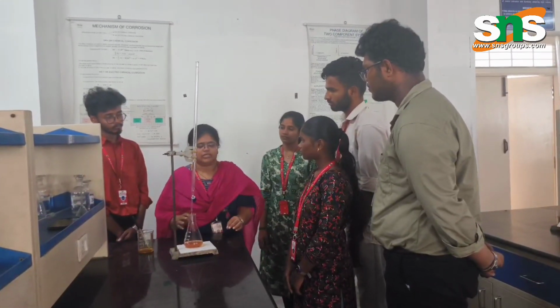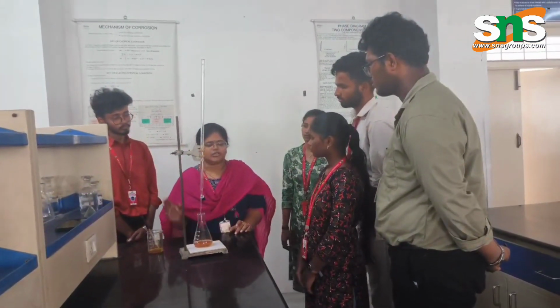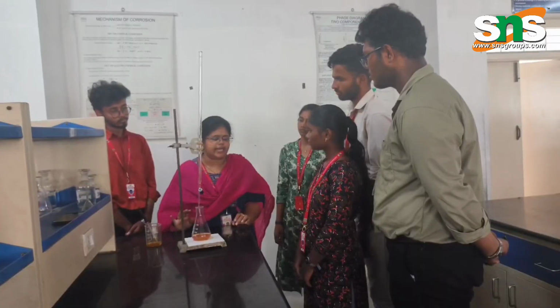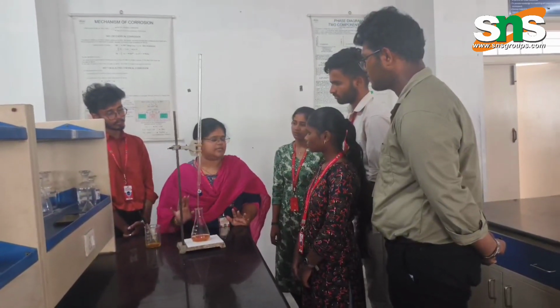So with this, we can conclude. Note down the reading and calculate the amount of chloride present in the sample water.